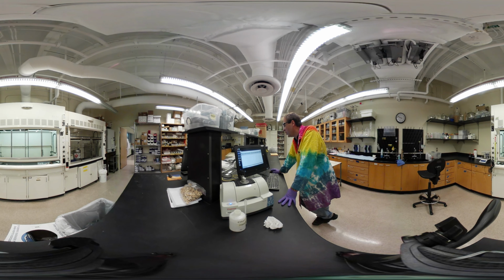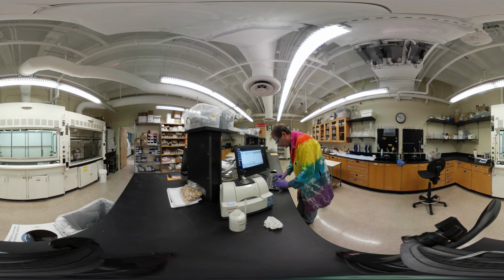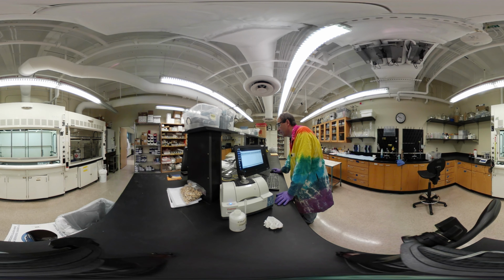And as always, we are going to find peaks. Set that around there so we can see what those actual peaks are. Okay. And save that. Save this. Find it. And print copy. All right, I need to go get our starting material, our product.